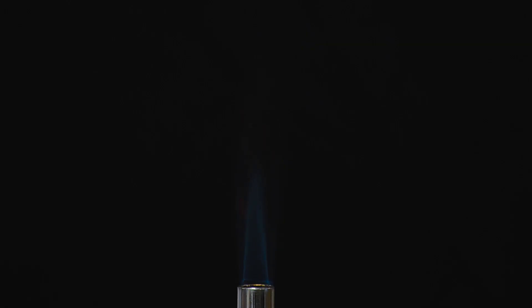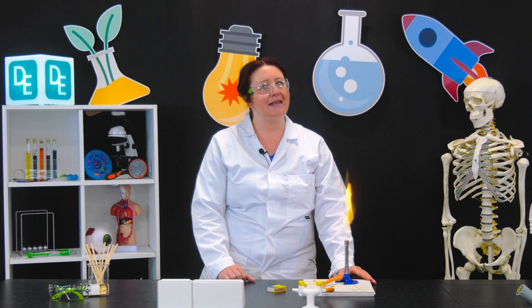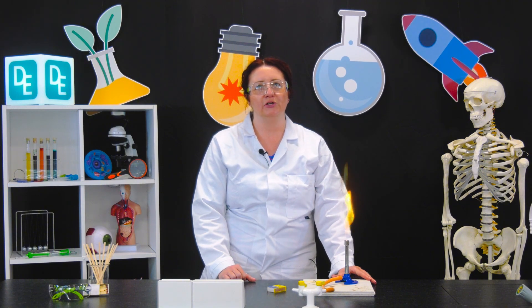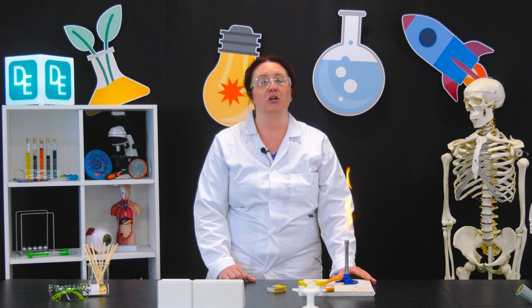Always make sure to turn the flame back to yellow when you're not actively using it. Never leave the Bunsen burner unattended while it's lit. If you need to leave, turn off the gas.